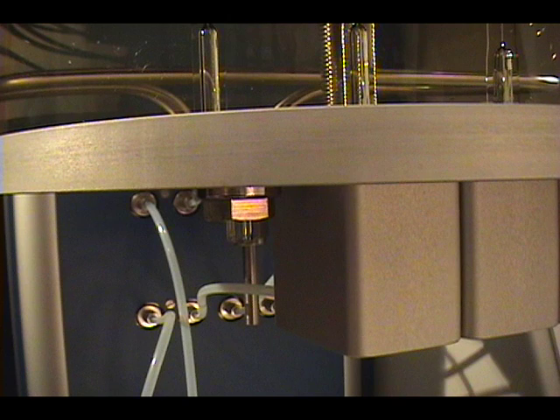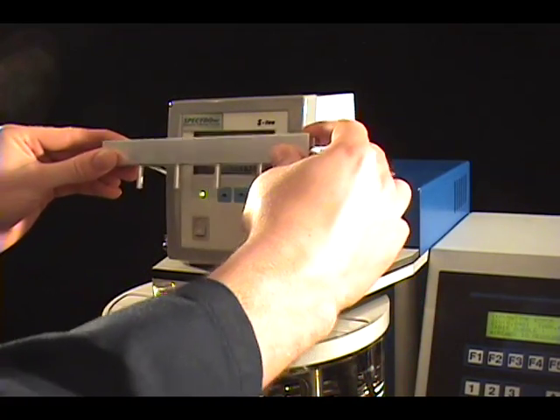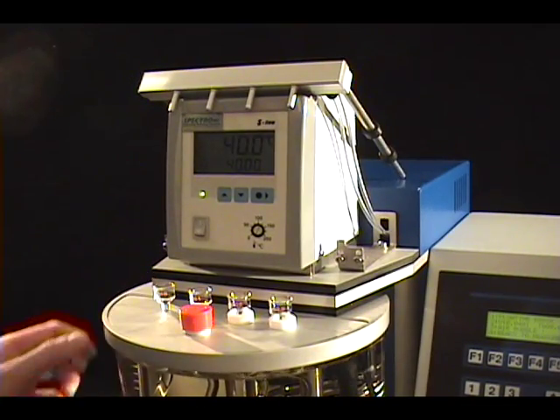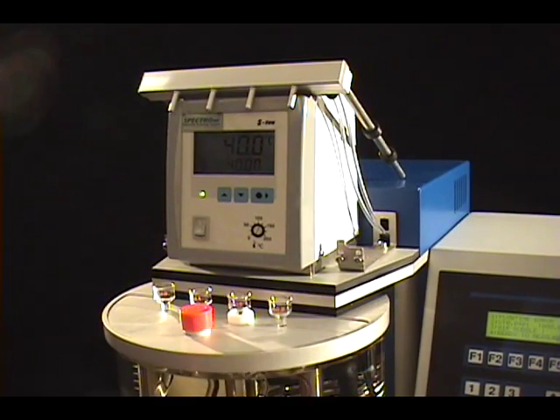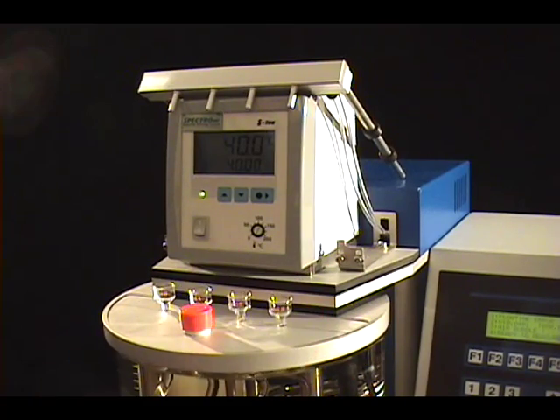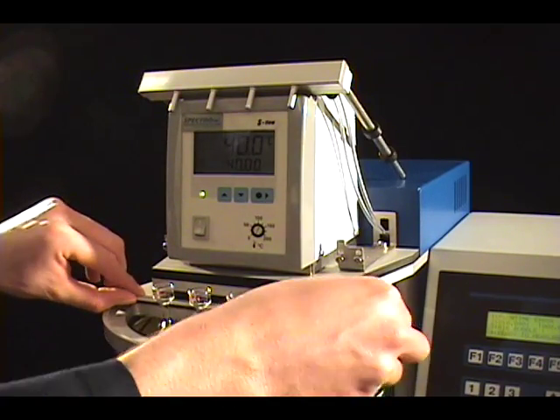Now you have access to the end of the glass tube on the underside of the bath. To free the top of the glass tube, you must remove the solvent injector from its holder and place it on top of the thermostat. The white spacers, which ensure the constant positioning of the measuring tubes, are removed. By doing this, the thermostatic bath lid becomes accessible. The bath lid, consisting of two parts, is removed.